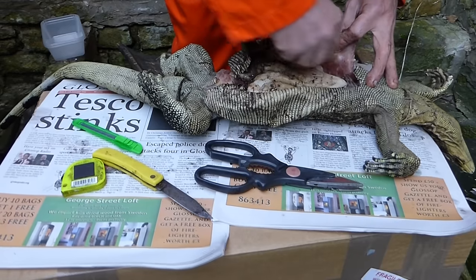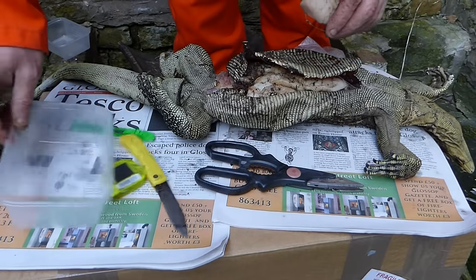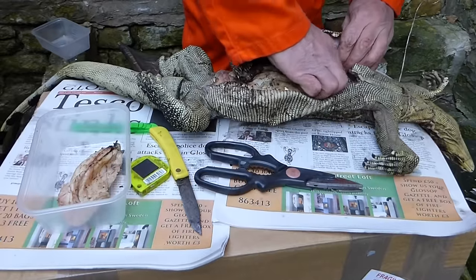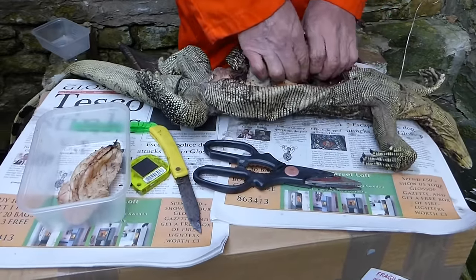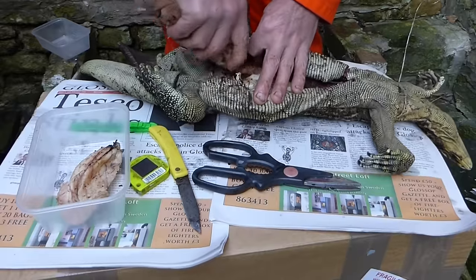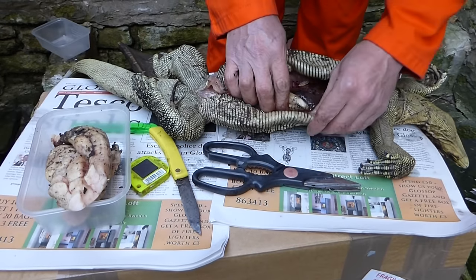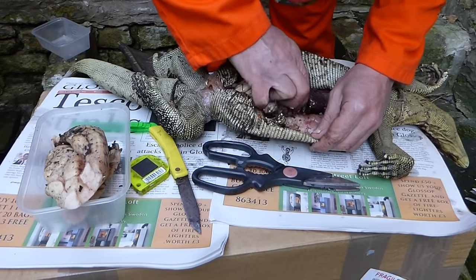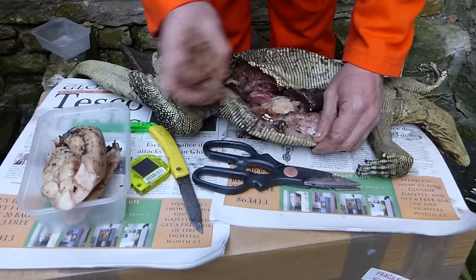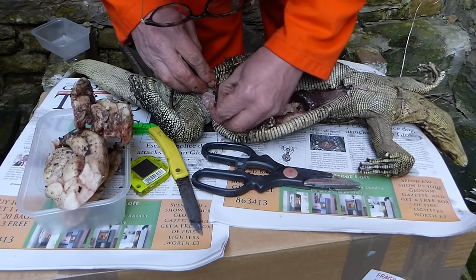In a lot of places this fat is considered really, really good for cooking. These ones weigh about 21 grams — I'd better check again. It's all quite frozen. There's an expression from the north of England — I think it comes from a football player who played for what later became Manchester United, and he was quite tubby, so they used to shout 'who ate all the pies, who ate all the pies' — but that hasn't got much to do with anything. So we'll just take all the fat out.